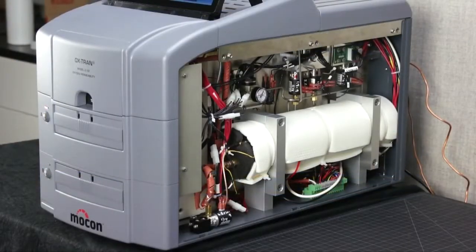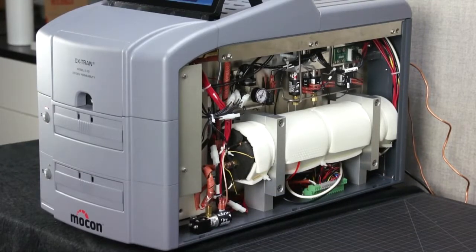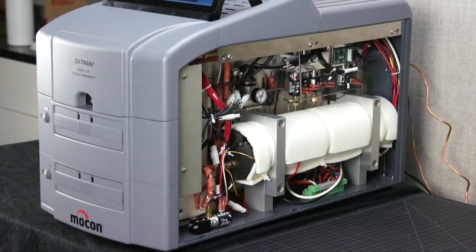An improved Coulox coulometric sensor with faster response time has been developed for the OX TRAN 222. This is an absolute sensor that measures every molecule that permeates through the film, a reason why MOCON instruments are the only instruments that conform with ASTM D3985. Because it is an absolute sensor, no calibration is needed. The sensor is protected from oxygen over range, and built-in safeties will automatically recover it should oversaturation occur.